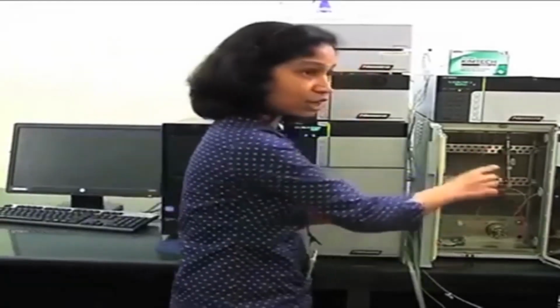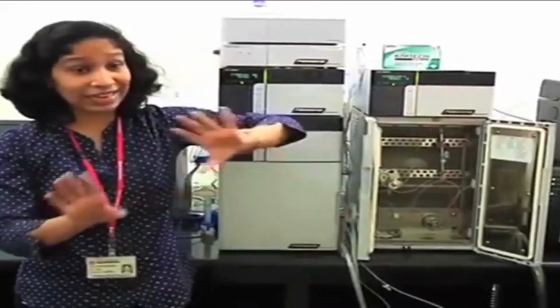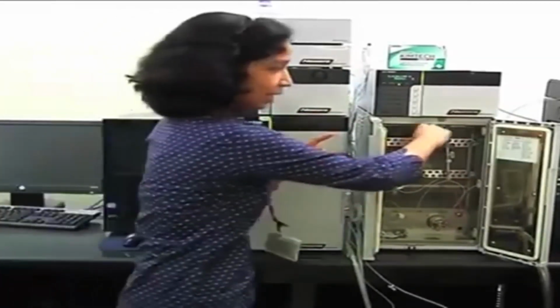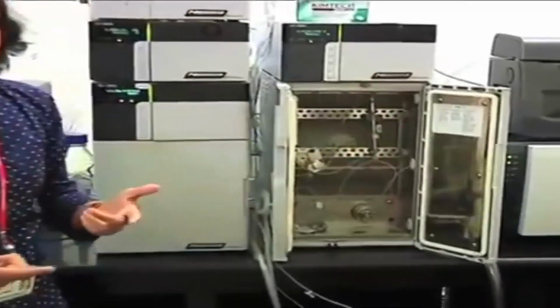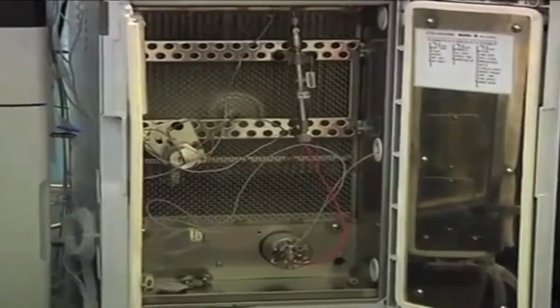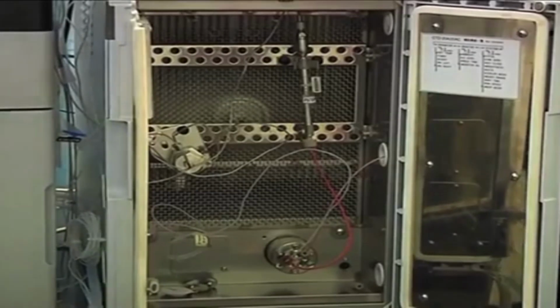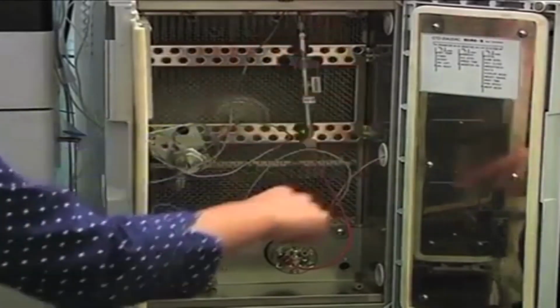There is one slight disadvantage: the part which is coming directly in contact with the heat block might get some extra heat as compared to the other part. Okay, so heat blotches might get formed. To avoid this scenario, here a forced air circulation type of column oven is used. Can you see? Okay. So here the column is not coming in contact with any hot surface. This entire chamber will get heated up, and there is a fan rotating behind, which will circulate this hot air uniformly throughout the chamber. So uniform heat distribution is there, and there will not be any heat blotches formed. Okay. So that is the advantage of this column oven.